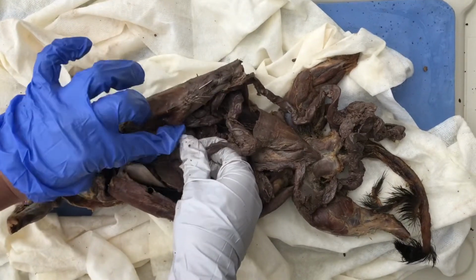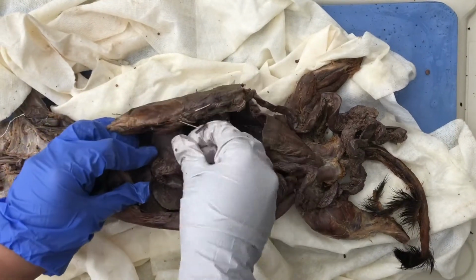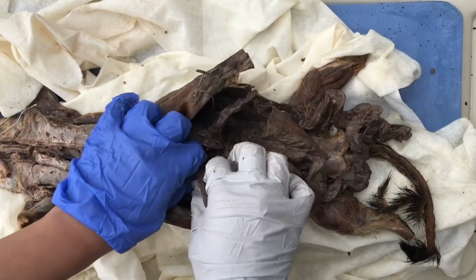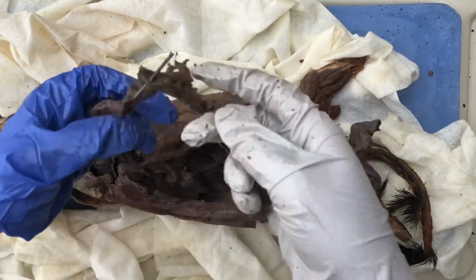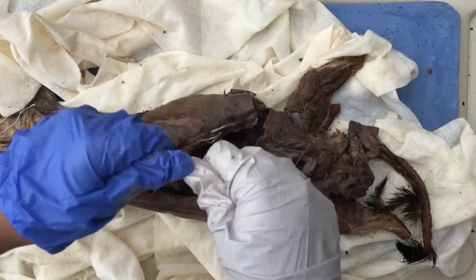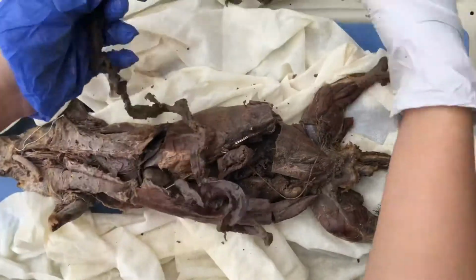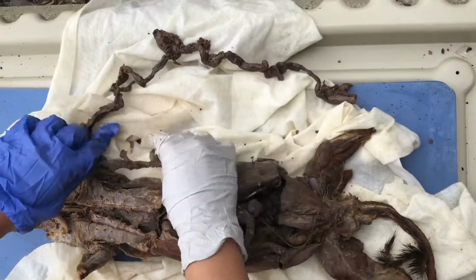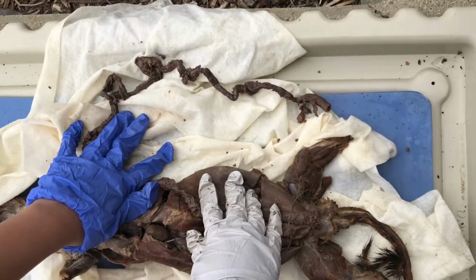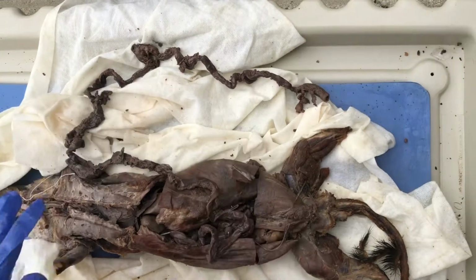So the small intestine starts off with the duodenum, which comes out from the stomach, and both the stomach and the duodenum function in chemical digestion and breakdown of foods through enzymes and other stuff like that. And then the rest of the small intestine includes the jejunum and the ileum, which function in nutrient absorption, and then finally the large intestine. Then you'll have the ascending colon, the transverse colon, and the descending colon, and those function in protection with the bacteria and stuff, and water reabsorption.